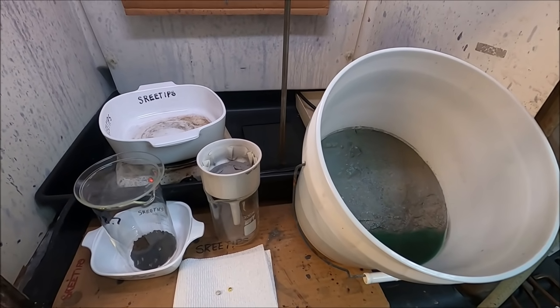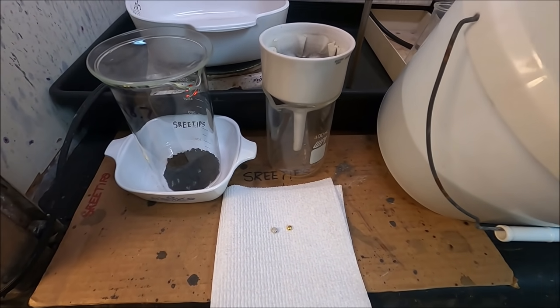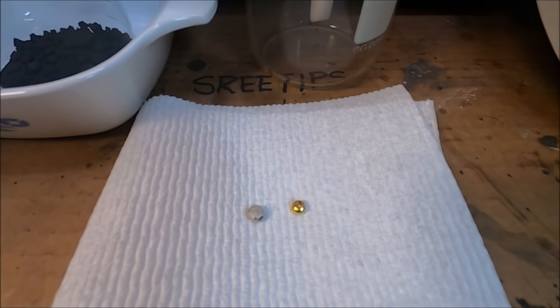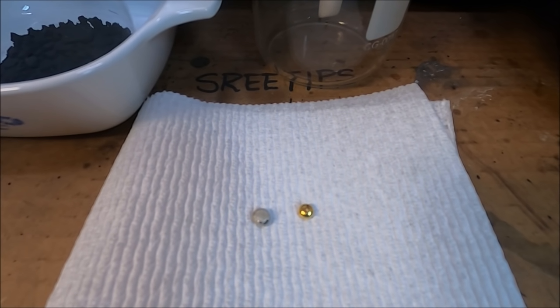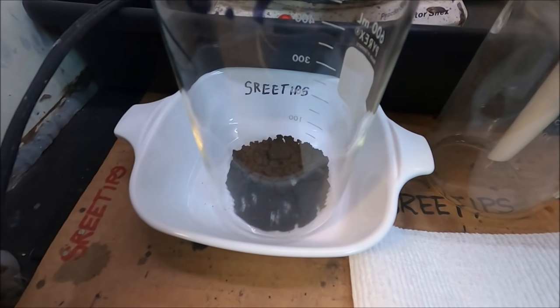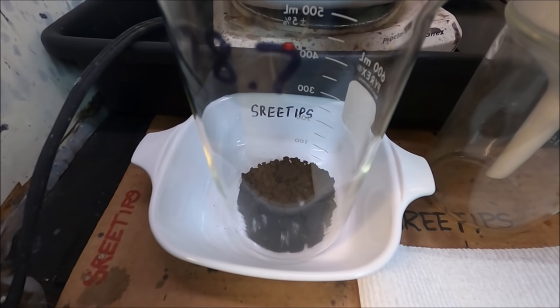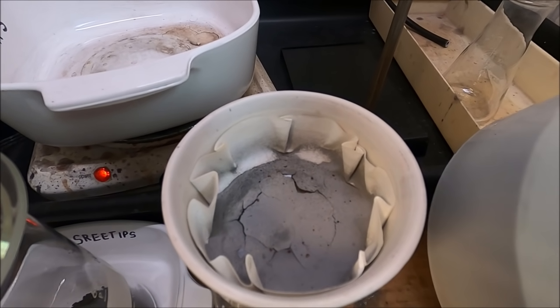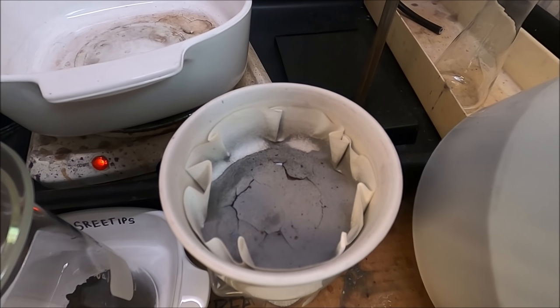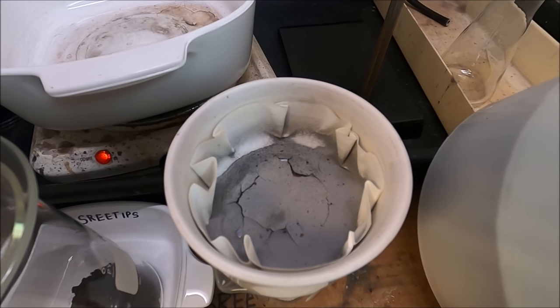Welcome back YouTube viewers, part eight of the series. Quick review: we've got two little gold buttons that we've recovered so far, and I'm going to try to work with those and re-purify them. Over here I've got about four grams of platinum group metals that we've recovered so far, and I'm going to do a purification on those metals. This is the filtered-out solids that I recovered — I wasn't sure if that's rhodium or not. I'm going to do a couple of experiments to see if we can get some of that to go into solution and then test it for the presence of rhodium.